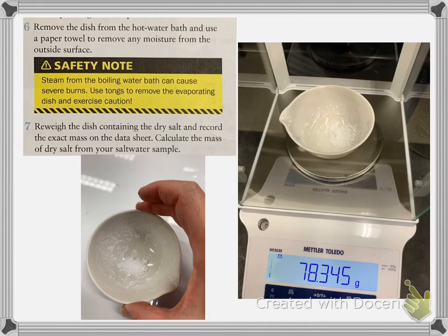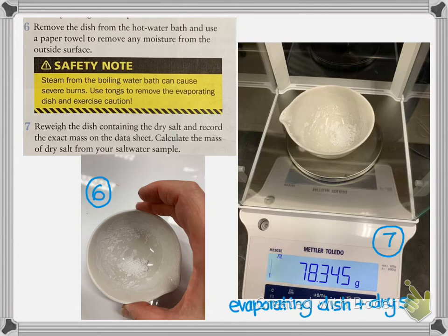So then I took it off. You can see here in this picture, this is from step 6. I took the dish off the hot water bath, dried off the bottom, and let it cool so that it was just room temperature. And then in step 7, I waited again. And so this is the dish with the dry salt. You will need to record the mass of the evaporating dish plus the dry salt. Okay, so on step 7, you're going to record it.